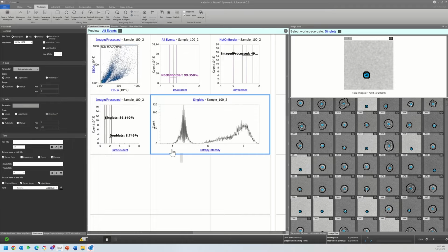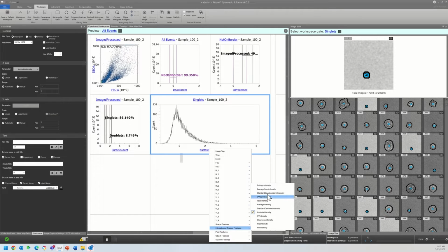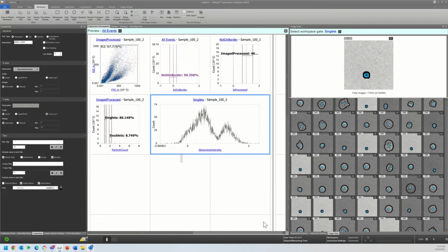And this is a great example of that resolution versus, let's say I was interested in kurtosis. See this, I'm not seeing the same clear resolution between populations, so I may not focus on this parameter quite as closely. We can see this with standard deviation versus skewness.